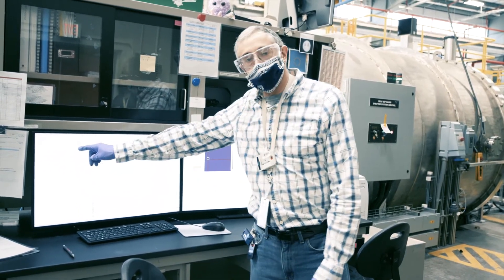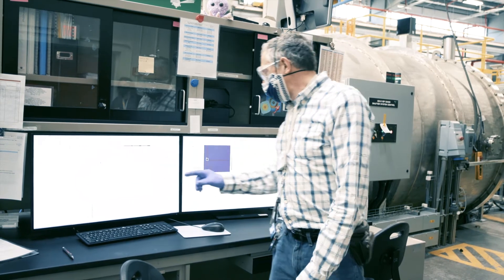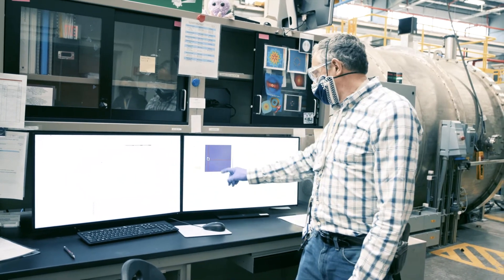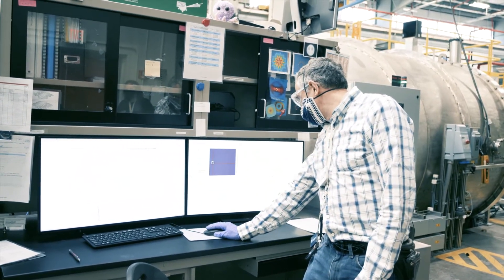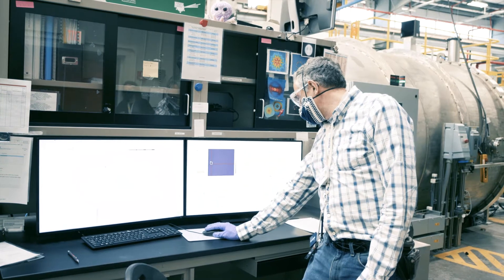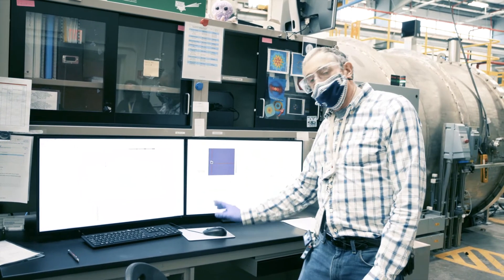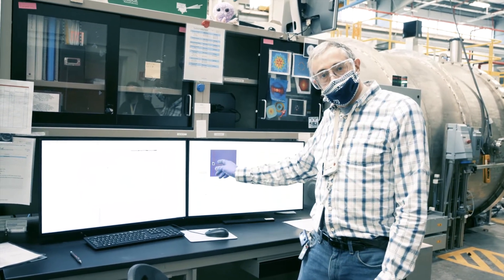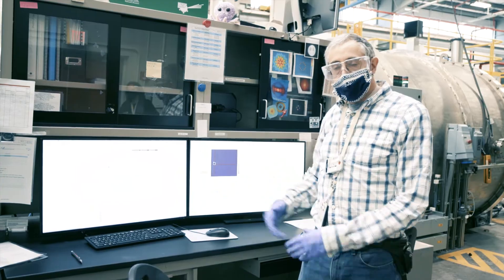Right now it's configured for 700 Celsius, and then we set our detector so that it measures every minute — it resets the pattern every minute.